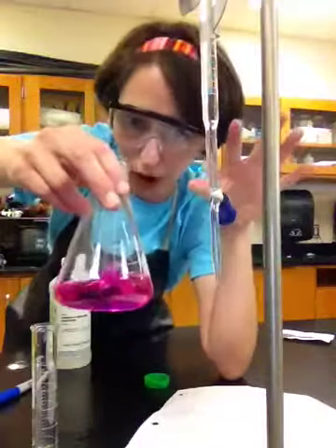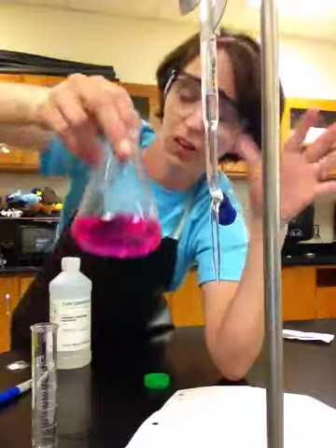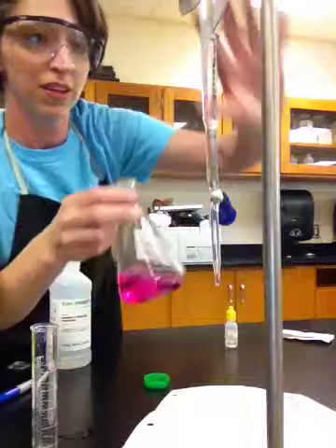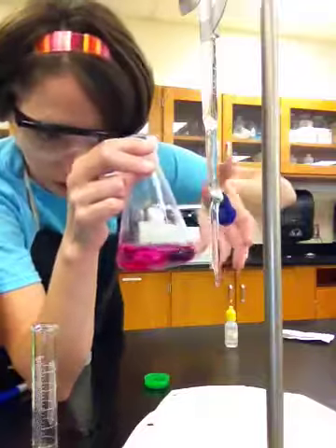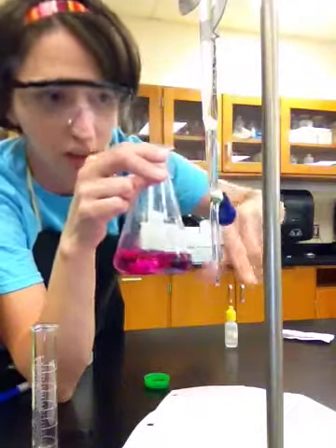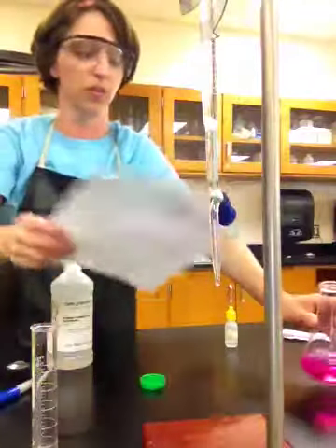Okay, now you could probably say that I went over the equivalence point just a little bit, because really what you're going for is like the lightest shade of pink ever, okay? So basically, I added enough base to neutralize the acid, and then I just went a pinch over. So that's why the whole solution went to pink, because phenolphthalein is pink in the presence of base. All right, well, you guys, that gives you an idea what a titration is all about.